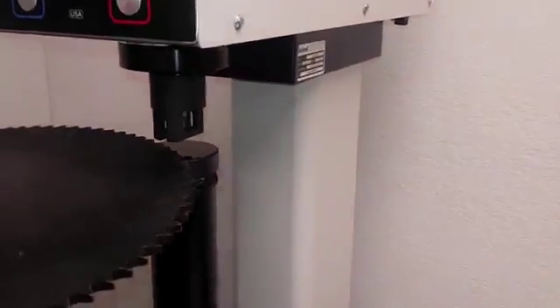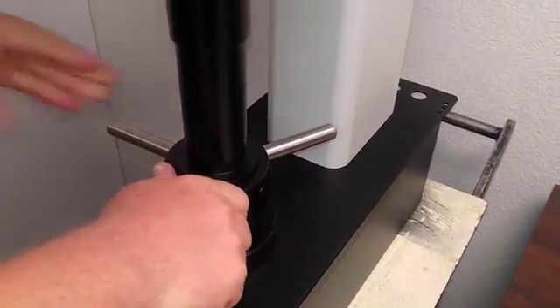In this case, we're going to use a 13-inch spur gear — slide it on, then turn the hand wheel to lock the part in place.